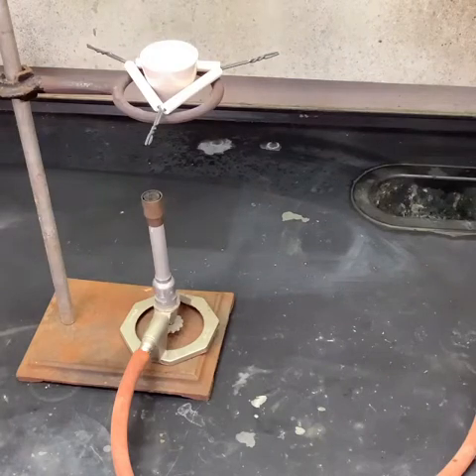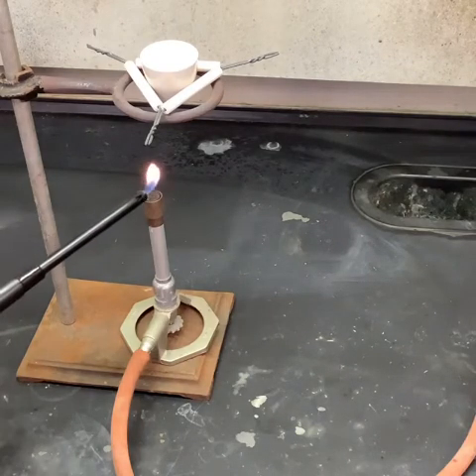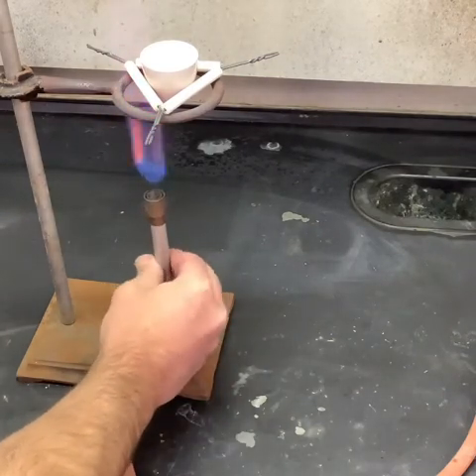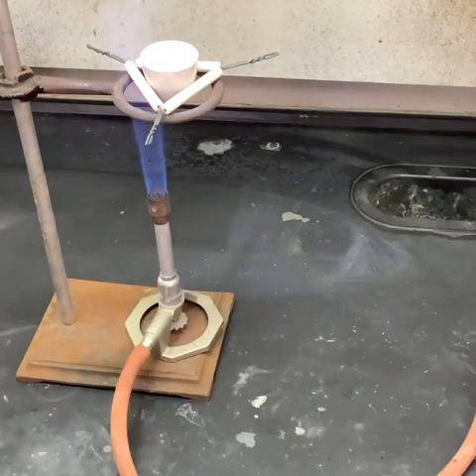Sorry about that. New classroom. The gas shuts off if it doesn't get used for a few days. So, okay. So let's adjust that a little bit. Definitely too much gas on there.